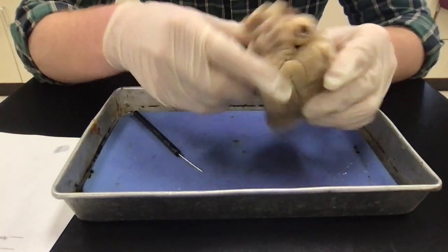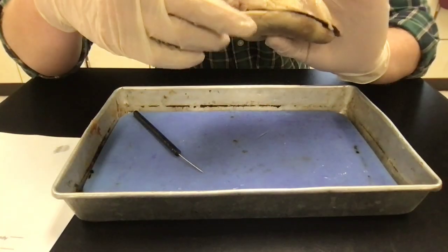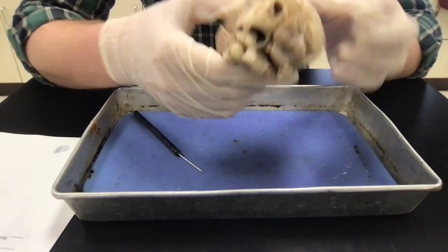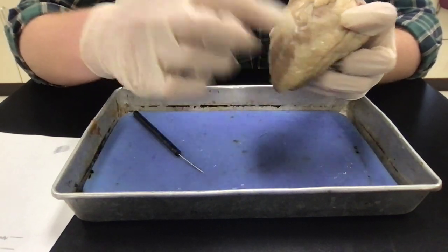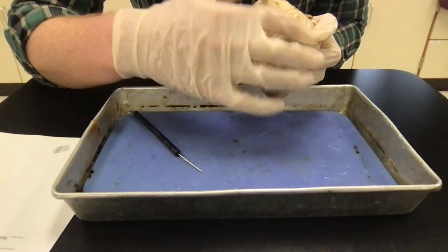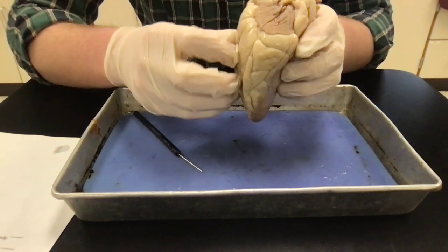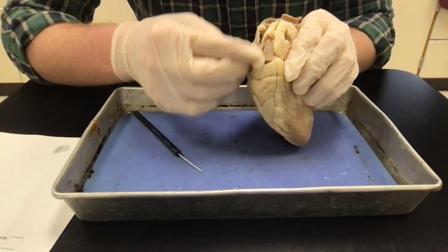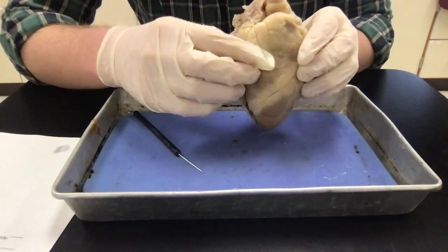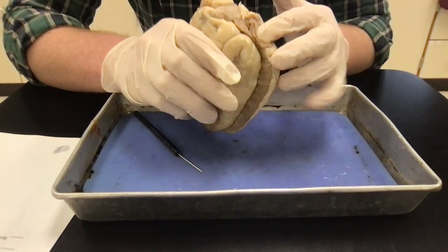And then your auricles. These are going to be these dog ear things, right? Auricle means ear. Okay, so it's this structure and then this structure, and for that, just know this is my right side of the heart, and then this is my left side of the heart, and then when you open it up, you can see the chambers. So this is going to be my left auricle because it's on my left side of my heart, and this is my right auricle because it's on the right side of my heart. Okay, right auricle, left auricle.